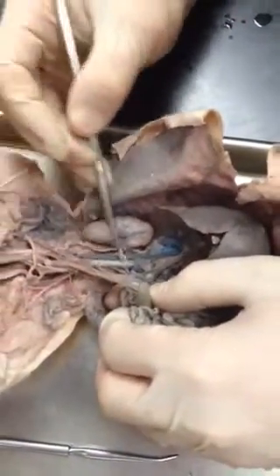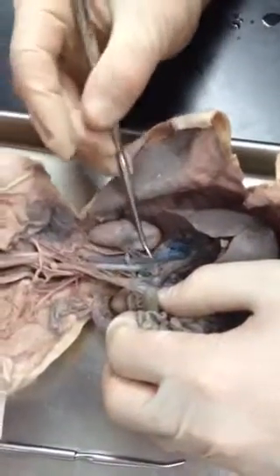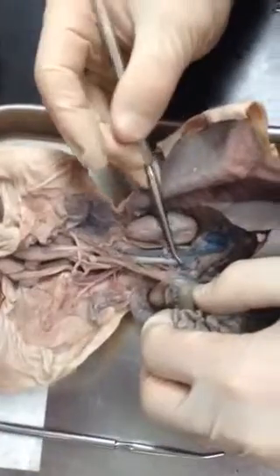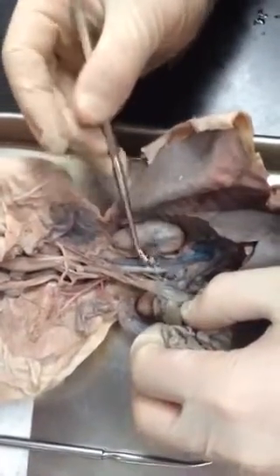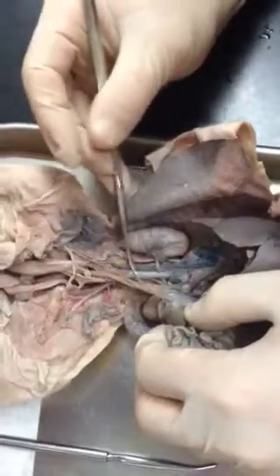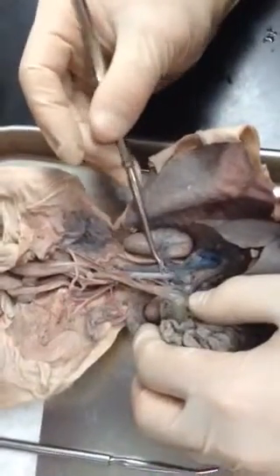That's the renal artery. You have to make sure to look at where it's connected. If this is the postcava, then what's connected to the postcava would be veins. So that's the renal vein. This is an artery because it's connected to the descending aorta, so that would be the renal artery.